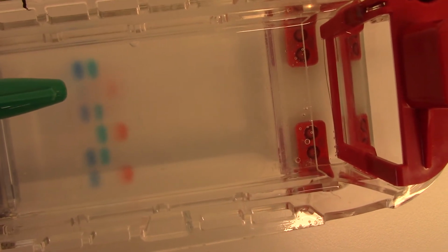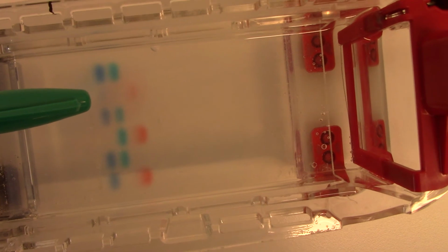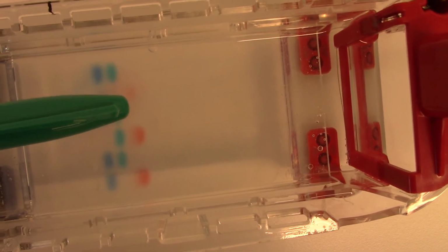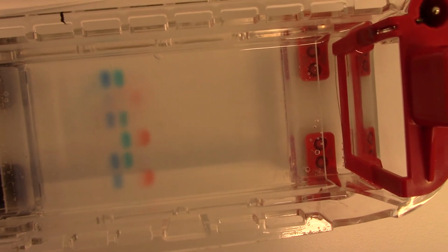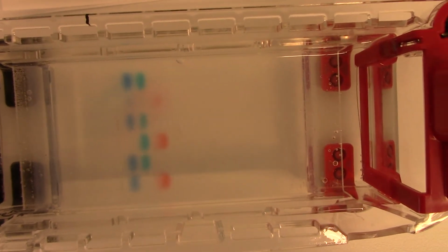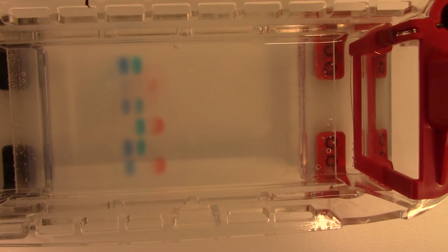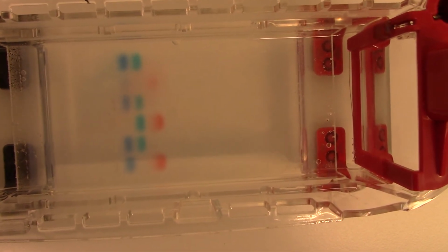Now, this lane right here, this second lane, the reason it is so faint, there's a little blue right there, and then there's a little bit of pink right there. The reason this is so faint is when I set up this gel, it had already been used, and there was a hole poked through the well, so the specimen actually leaked out. So what we see is a very faint band, and that's science. What happens, happens. I was able to recognize why.